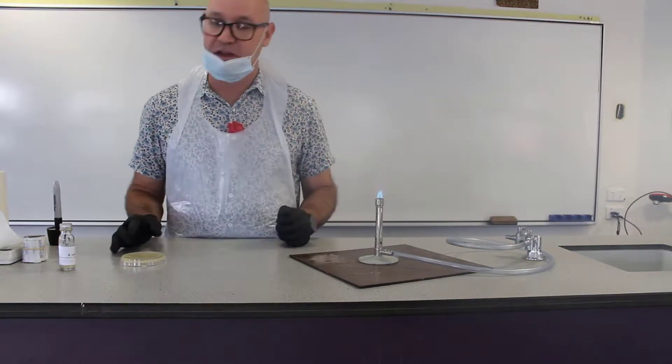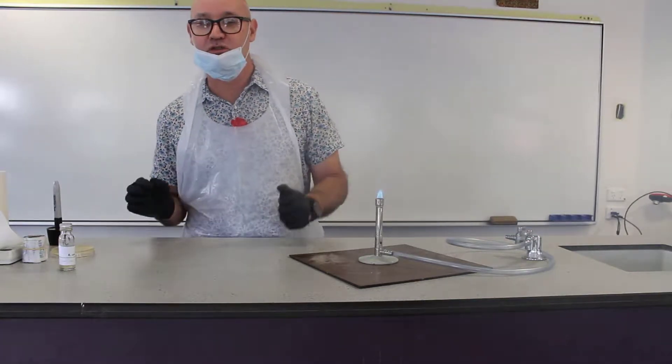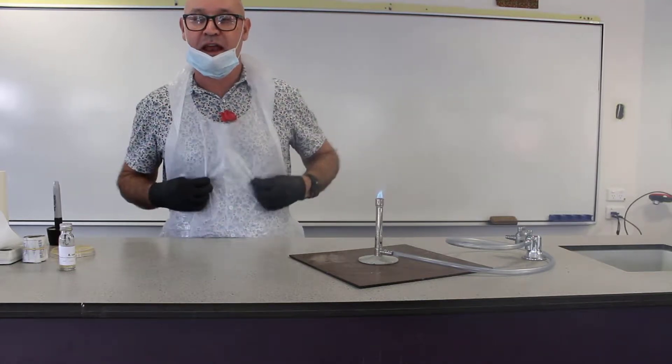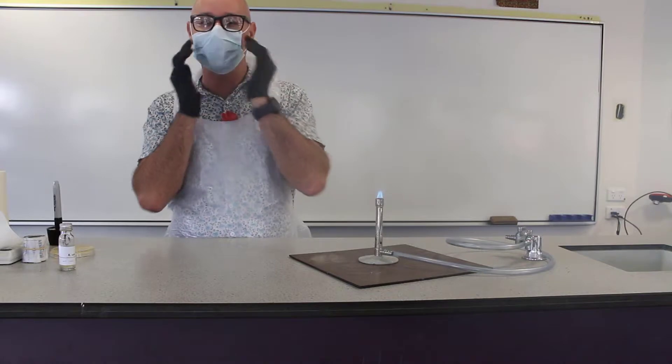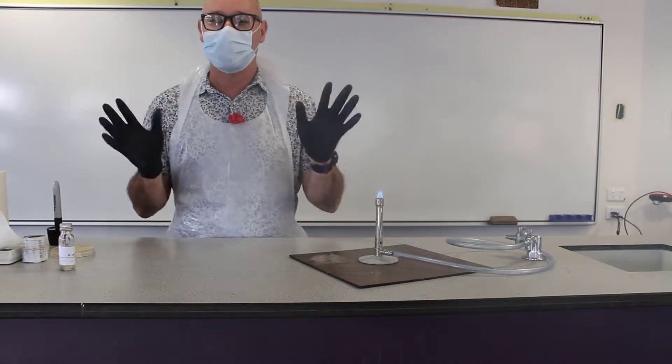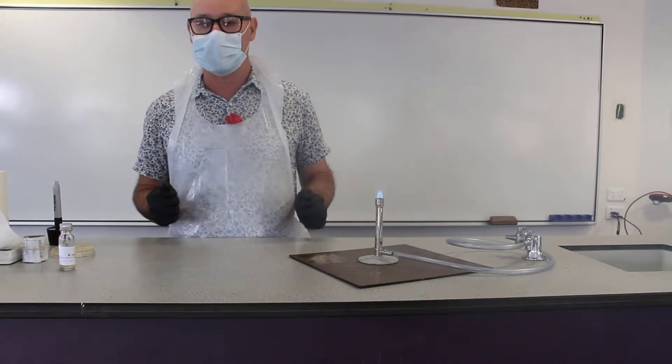The first thing we need to do is make sure that we're wearing gloves, an apron, and a mask. This is to make sure that we don't actually put any contaminants from our body onto the agar plate.